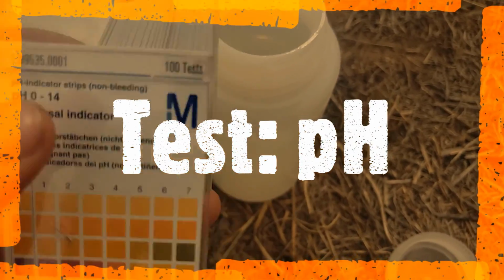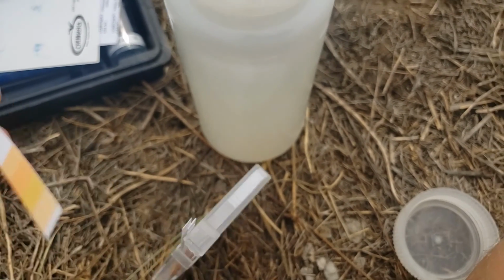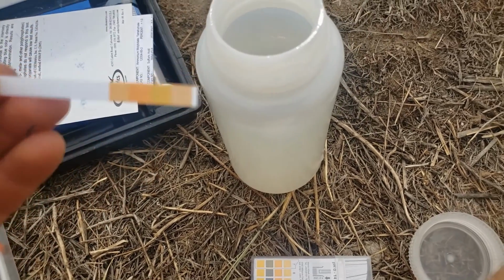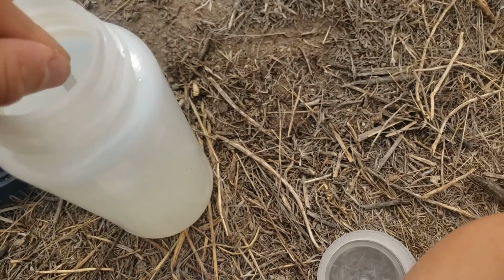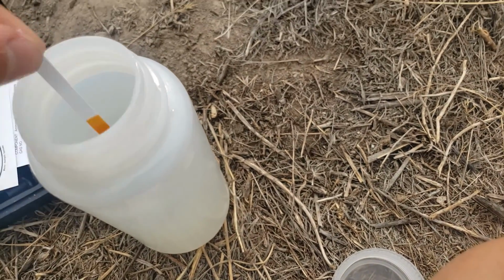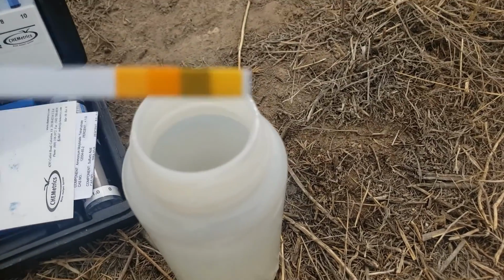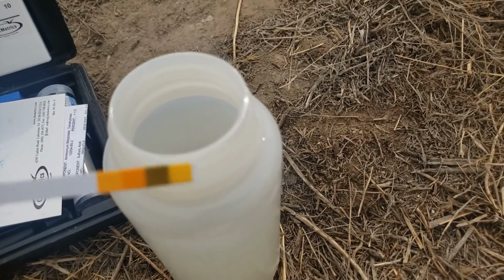So I have my pH indicator strips. I'm going to take one out. And this is what I'm going to put in there, and it's going to change colors based on the pH of the water. Okay, so did you notice that color change? Kind of hard to see on my camera.